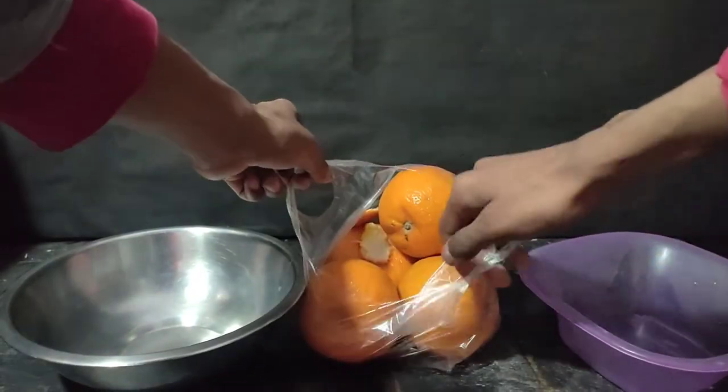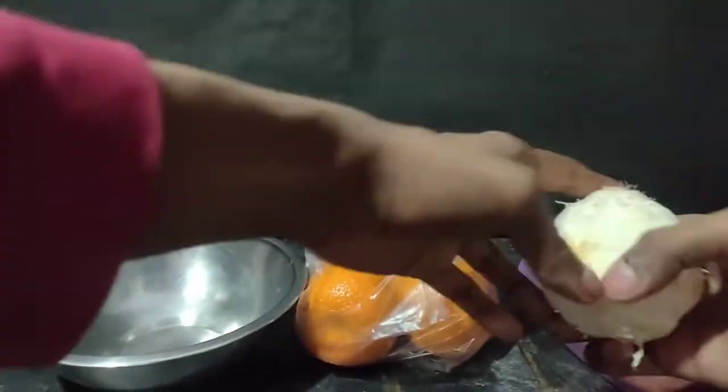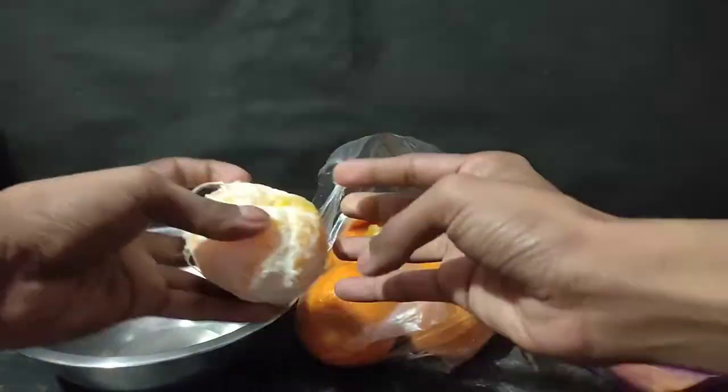Today I bought some oranges and I peeled them off so that I can take out their juice.